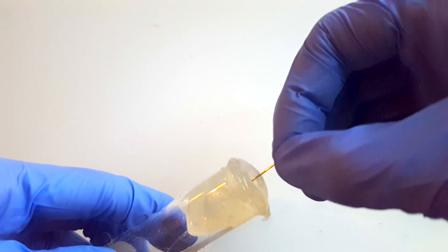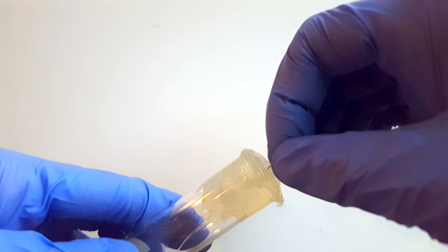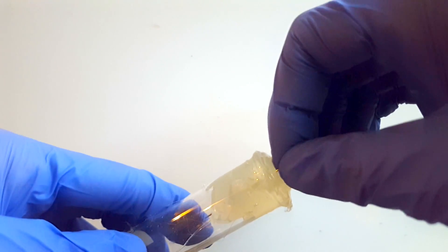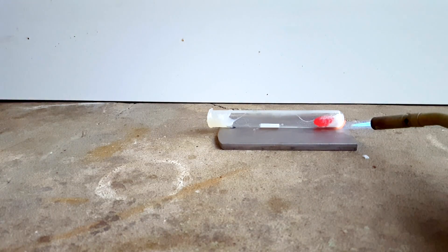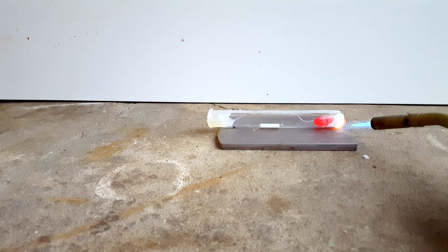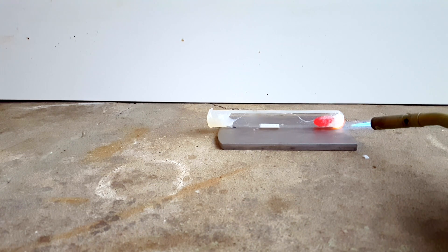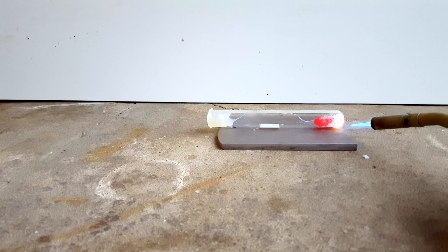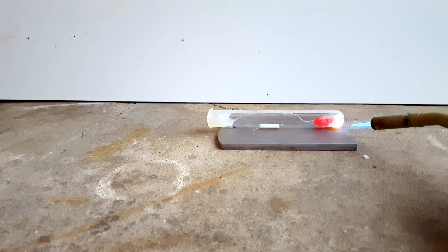Again, I will repeat, never try this at home. After it was all set up and the glue mostly dried, I lit the blowtorch, set it down, and ran for the hills. Nothing really happened at first, but when the sodium chlorate melted, things started to take off.